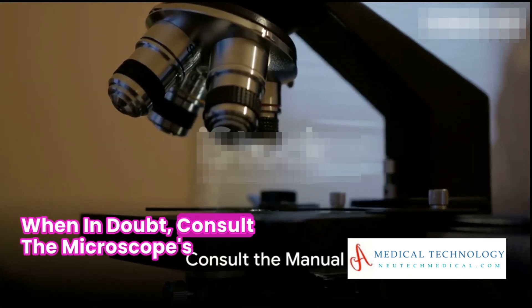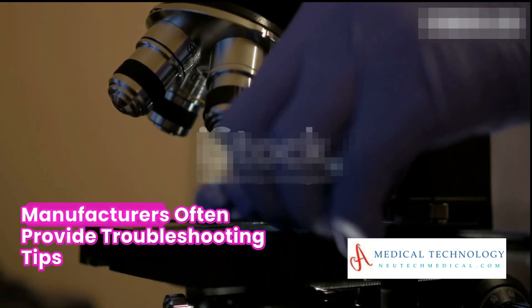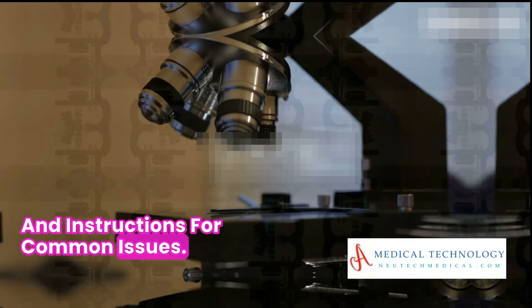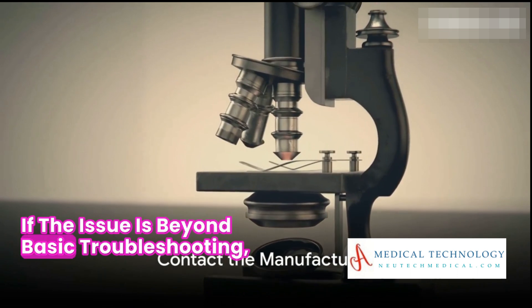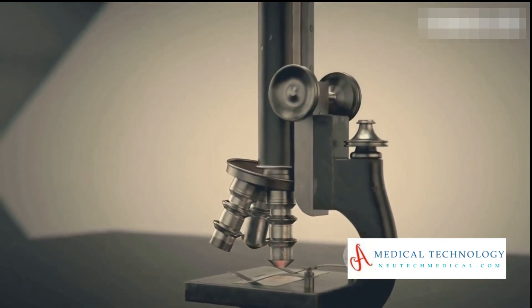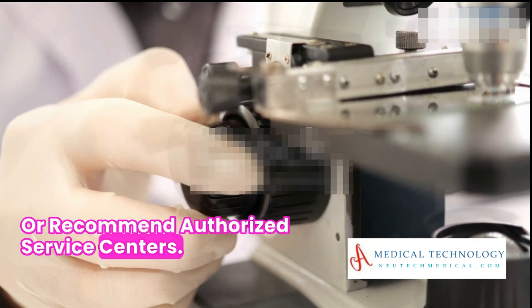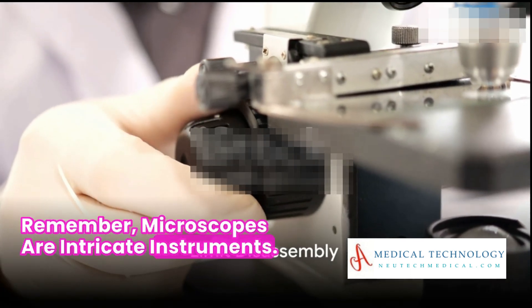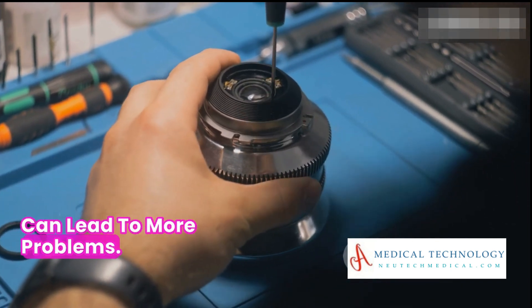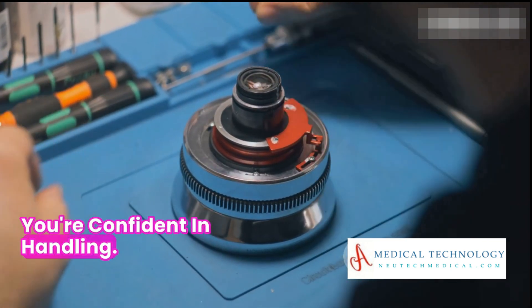When in doubt, consult the microscope's user manual or technical documentation. Manufacturers often provide troubleshooting tips and instructions for common issues. If the issue is beyond basic troubleshooting, don't hesitate to contact the microscope's manufacturer. They can provide technical support or recommend authorized service centers. Remember, microscopes are intricate instruments and disassembling them without proper training can lead to more problems. Limit disassembly to components you're confident in handling.